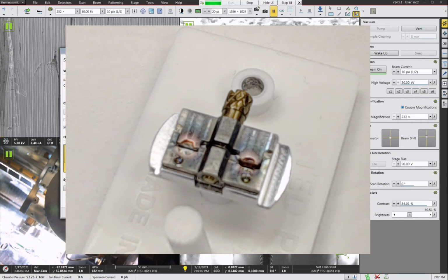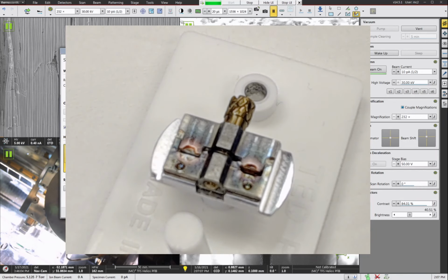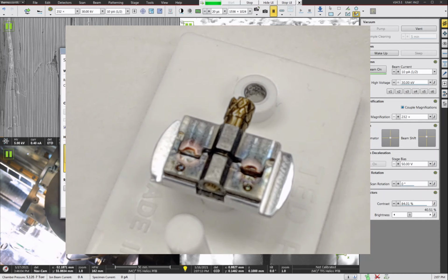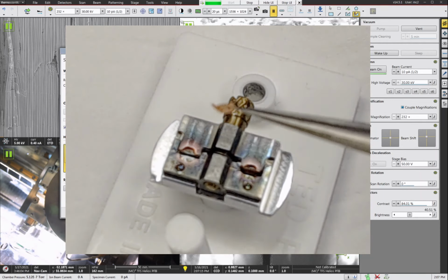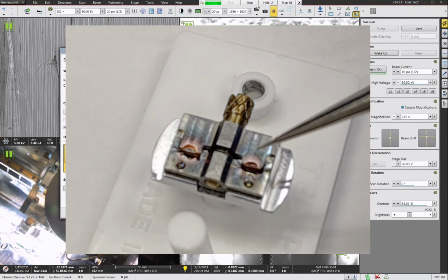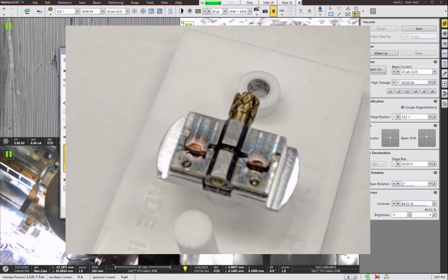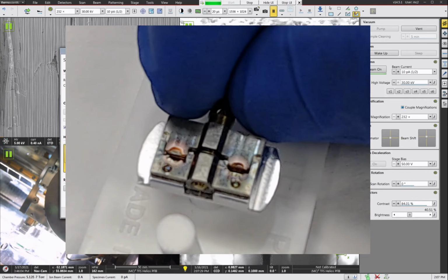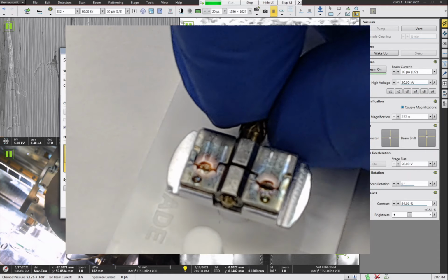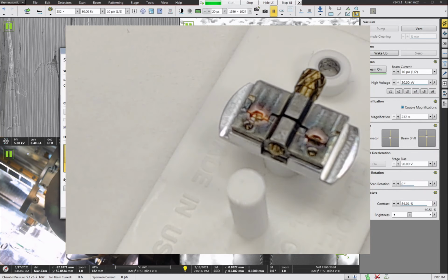Now, if you're going to do this procedure a lot, or especially if you're going to do this on the PFIB like I'm demonstrating, you should note that the TEM grid holder will get extremely contaminated with the grid material, in this case copper. And hopefully it shows up in the camera, but there is a considerable amount of copper residue all around this holder position from all the fib cutting on the copper. So if you have a TEM grid holder that you want to keep nice, I would recommend you don't use it for this procedure. All right, so we have our grids in our normal TEM holder.